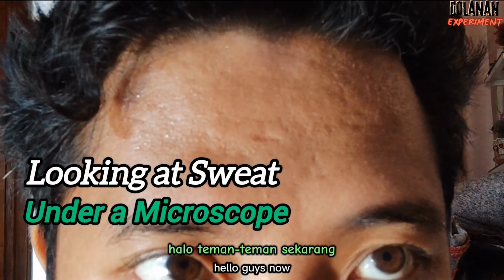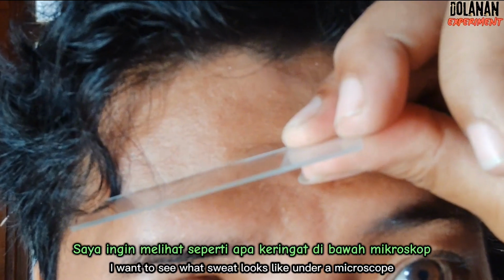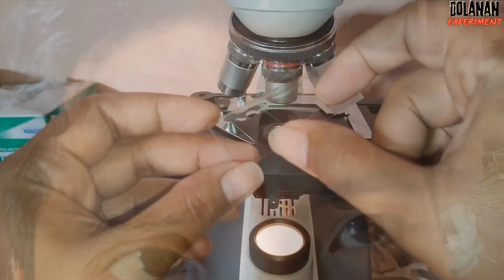Hello guys, now I want to see what sweat looks like under a microscope. I took a little sample from my forehead.